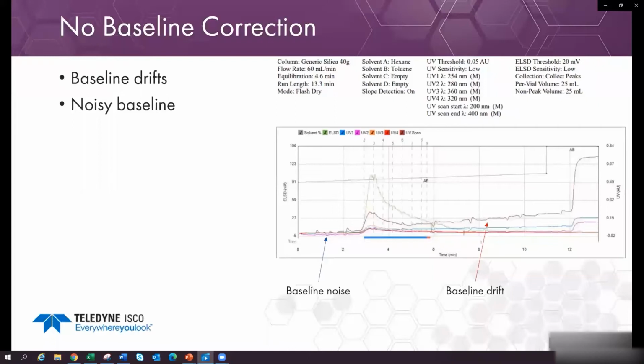Other instruments are unable to detect such compounds in absorbing solvent systems very well. Some systems will simply subtract the solvent from the chromatogram, and when you get a saturated system, it can't deal with detecting a compound very well. In this case, the system doesn't subtract it off, but it tries to measure the absorbance. The detector, being light limited, has baseline noise, and the baseline changes with the solvent composition.